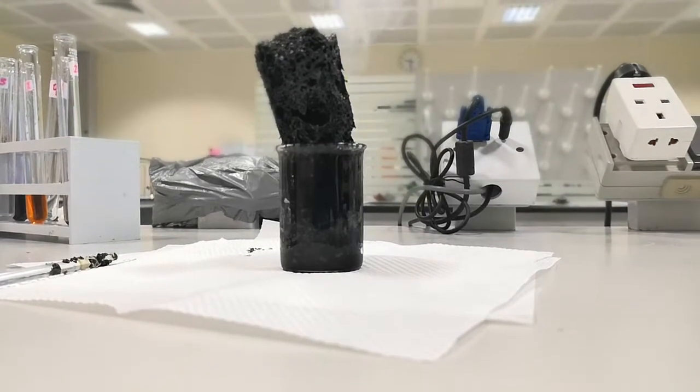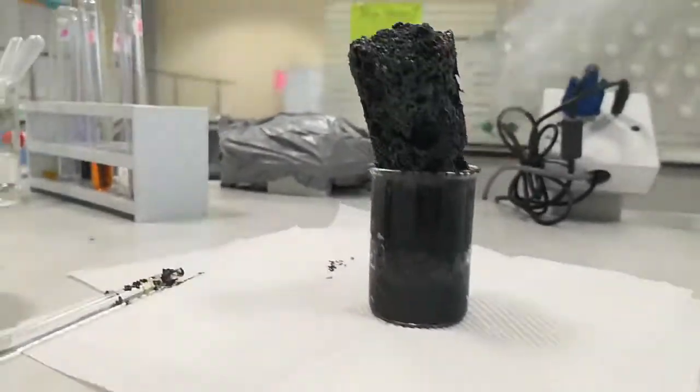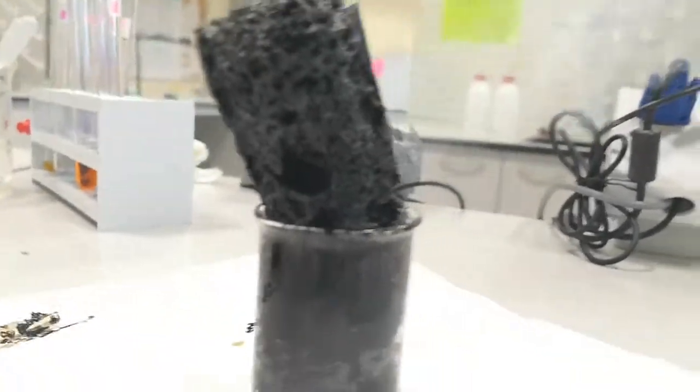See, this is exactly the charcoal. Just take a closer look to it.